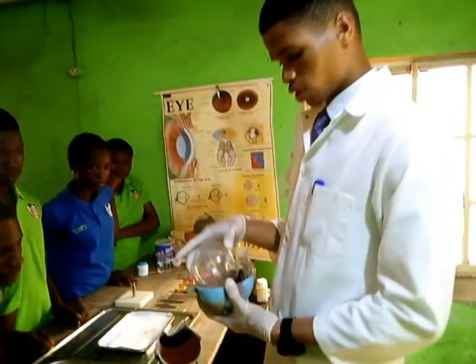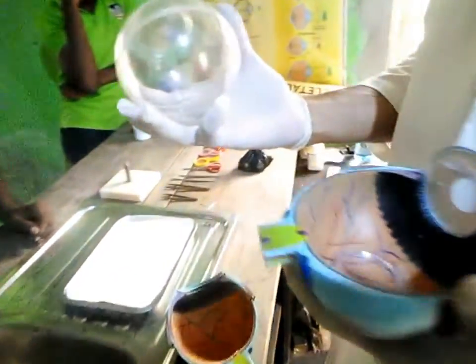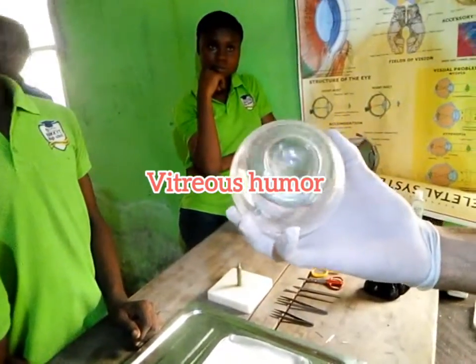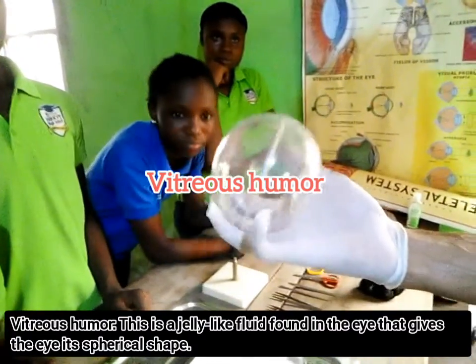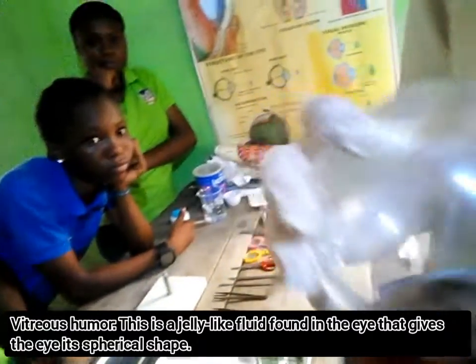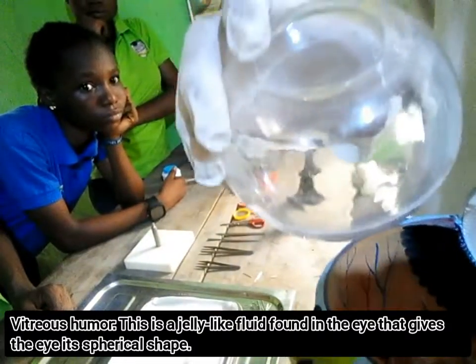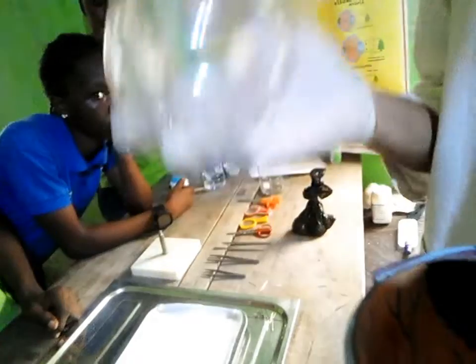Okay, now you see another structure here. I believe this should be the vitreous humor. It's a jelly-like fluid found inside the eye. It gives the eye its round shape. That's why this one was put here. It was not put here for fancy. In this one, even without this, the eye can still be the way it is, but this is to show you that there's something like this. This is a part of the eye.